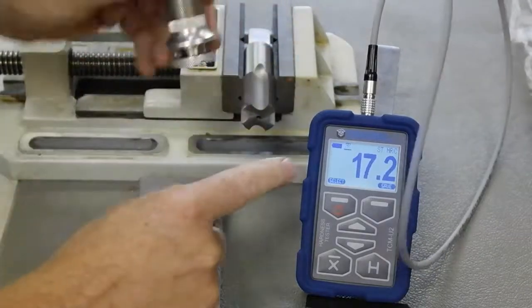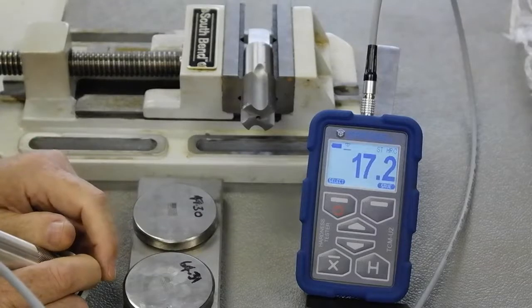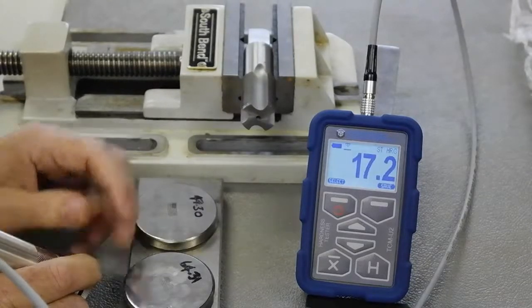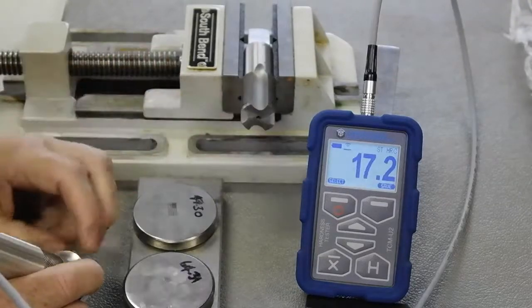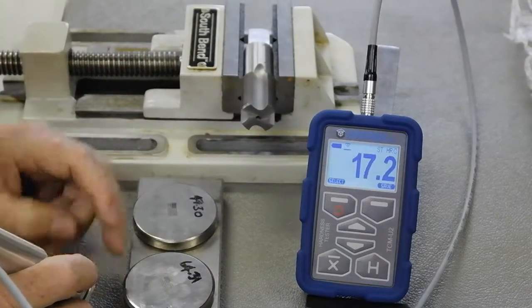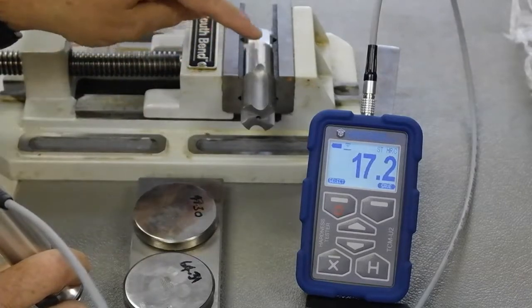And here it is actually doing a test and it's showing at 17.2. The device we certify for accuracy down to 20 HRC, up to about 65. So very hard down to soft. But you can see the device can also actually check lower. But you're going to get more variations at the very low end. I just wanted to show that this is going to show very soft.